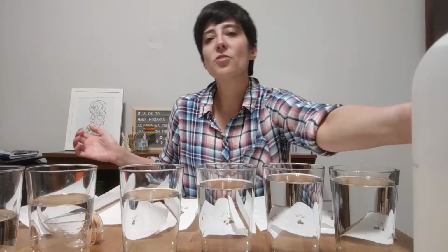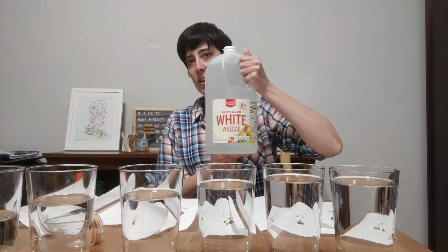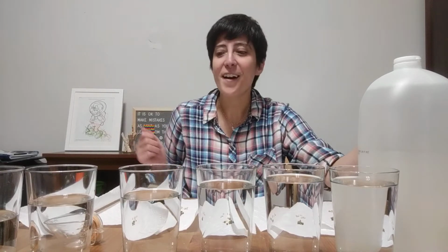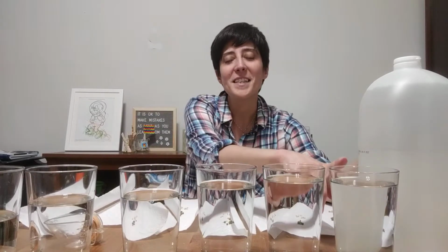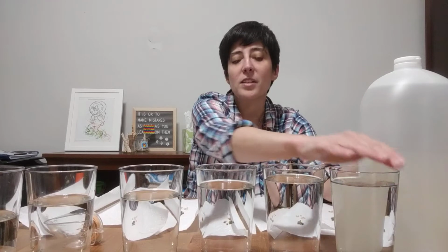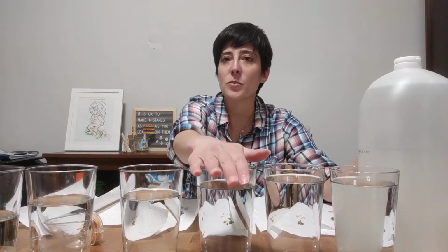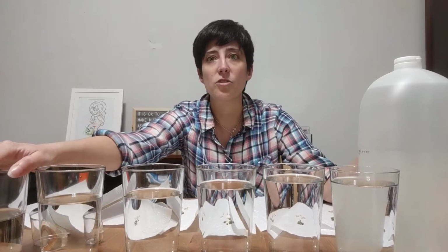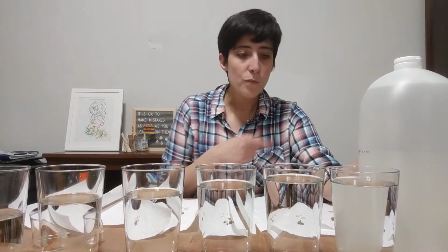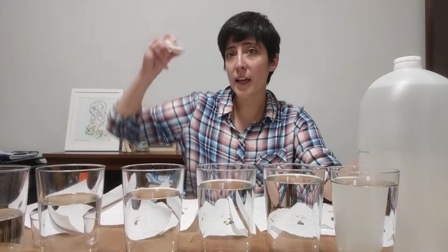Now, in order to make my acid rain, I have vinegar. This is a ton of vinegar. I'm not going to use all of it, but I'm going to mix varying levels of water and vinegar. I've pre-measured out all the water. This one has 400 milliliters, this one's got 396, this one has 375, 350, 300, and then 200. I'm going to need to put vinegar in each of these to get the volume up to 400 total. Once I do that, I'm going to measure the pH.